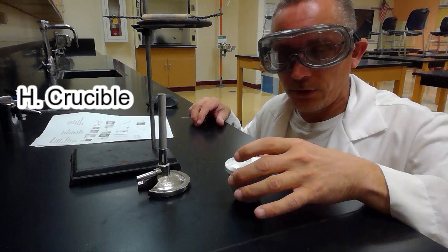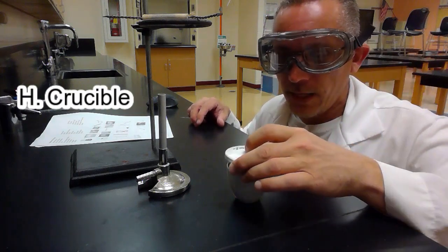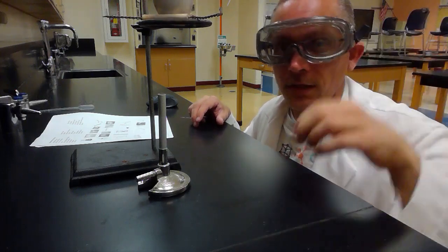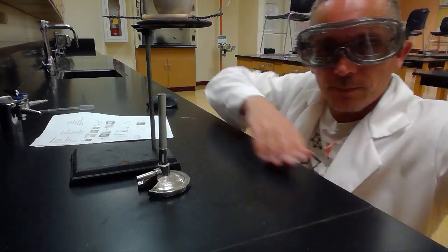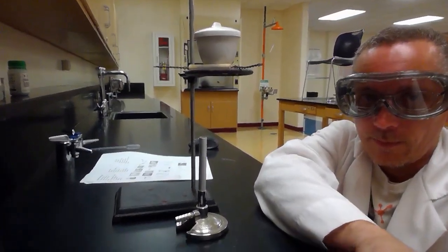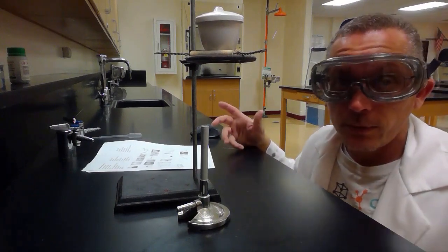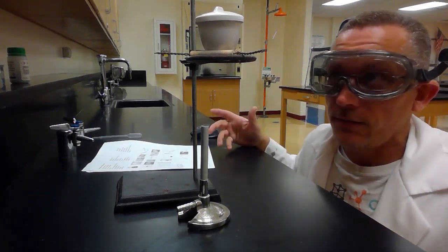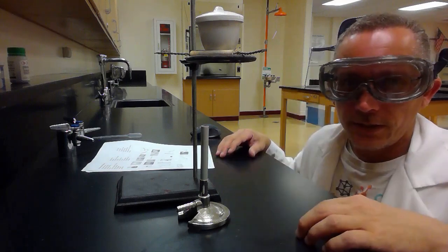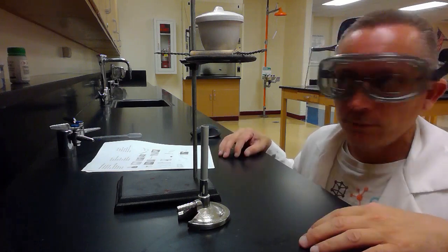Picture H is what's called a crucible. The picture doesn't have the lid on there. I have the lid here, right? And you can put the lid on there, and you can put this on top of the clay triangle, above the Bunsen burner. See if we can get it all in the picture there. There you go. And you can heat what's in the crucible. The crucible is used for heating things, and you can heat things to very high temperatures in the crucible, right? So you can put your Bunsen burner underneath it, it'll heat up what's in there, make it nice and hot.